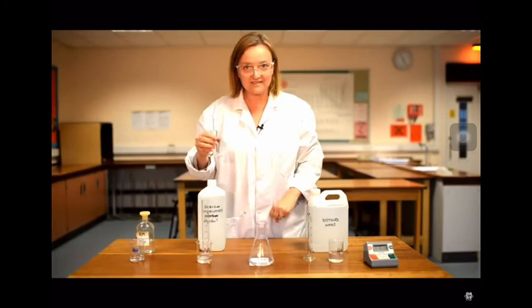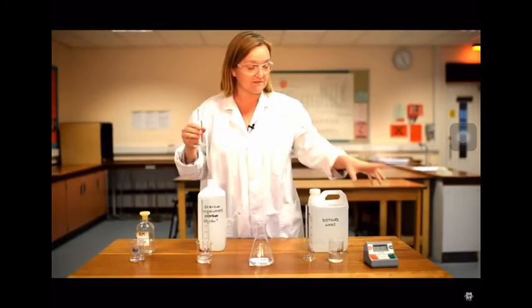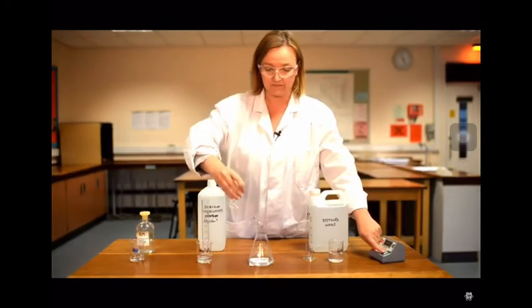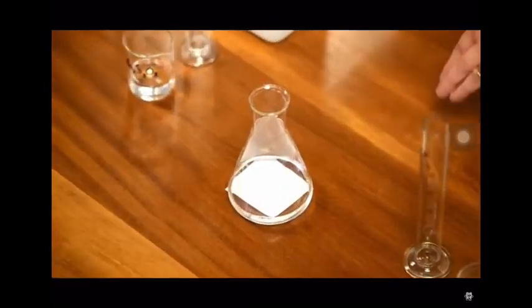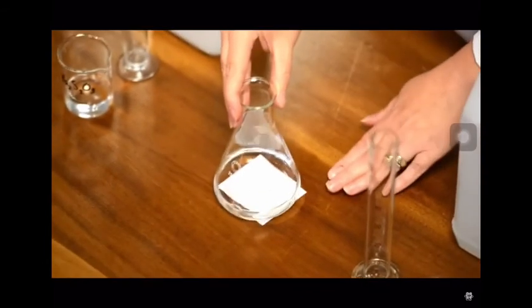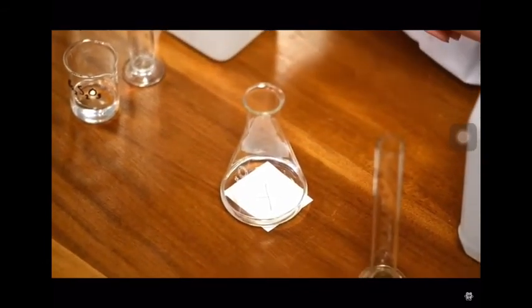Now, the reaction is going to start as soon as I mix the acid with my sodium thiosulfate. So I need to be ready with my timer to start as soon as I add it. Just a swirl or two to get them well mixed, and then I'm going to observe the cross through the solution by looking directly above.